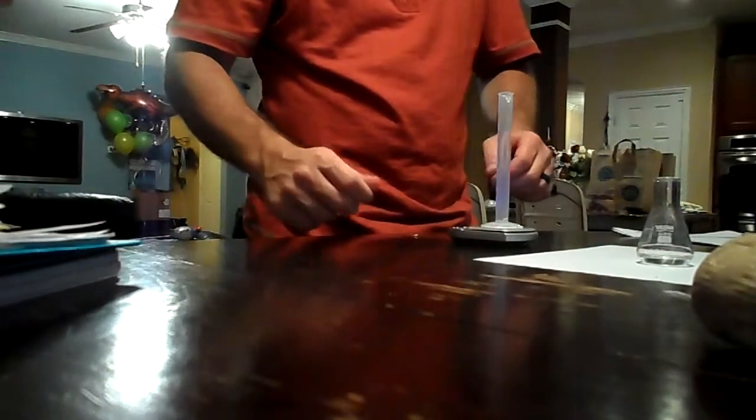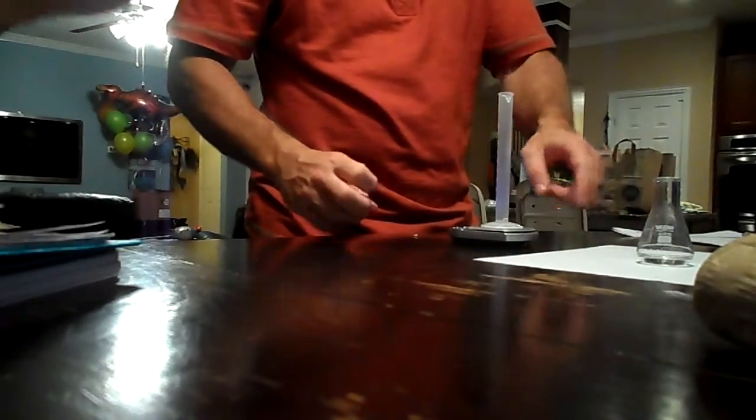Okay, so transfer vinegar into the clean flask. Okay. Add 2 drops of this fancy stuff to the vinegar. 2 drops. Oh, it's in the flask. Alrighty.